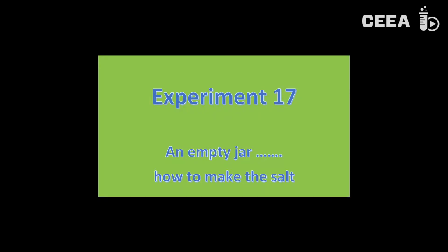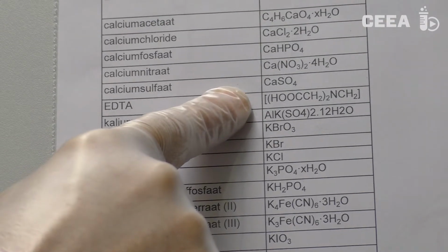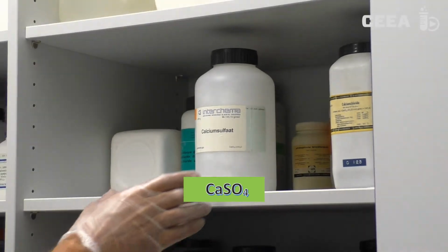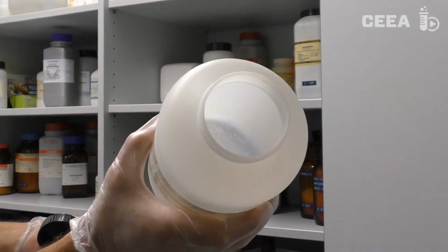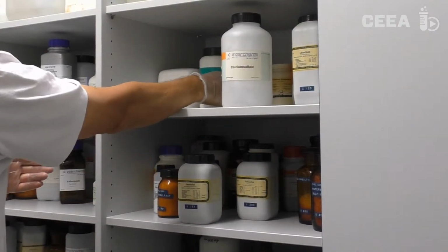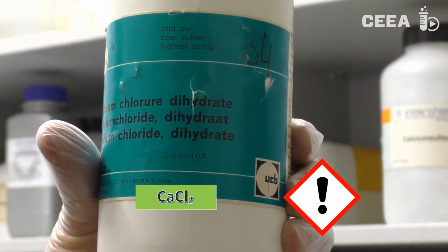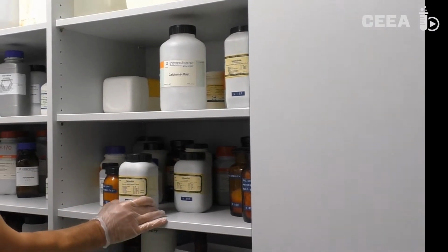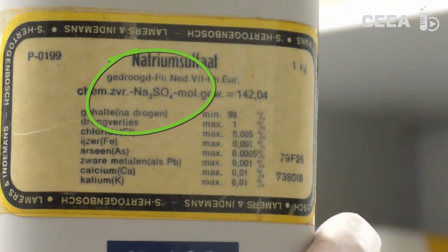Experiment 17. How to make a salt. My jar with calcium sulfate is empty. Fortunately, I studied my solubility rules well, so if it's not in stock, I will find a way to produce it myself. What I need is a soluble calcium salt and a soluble sulfate. Now let me see.